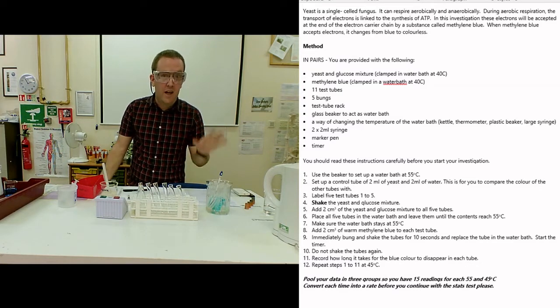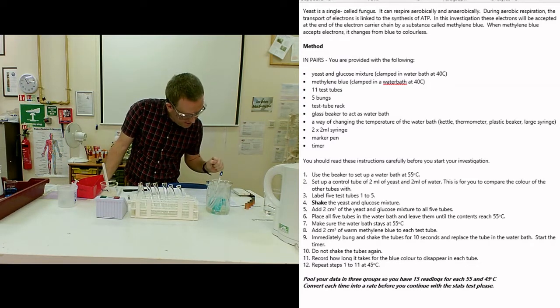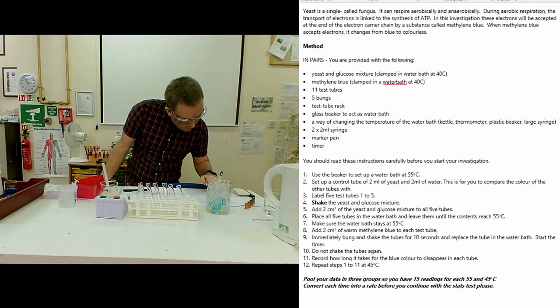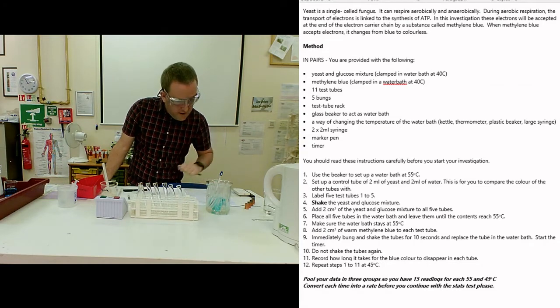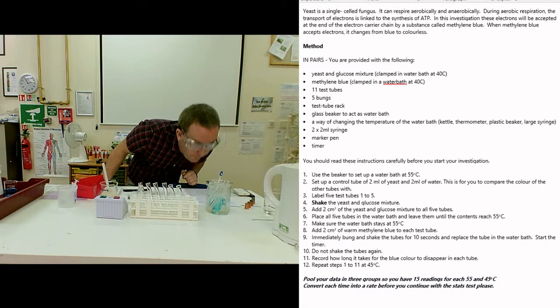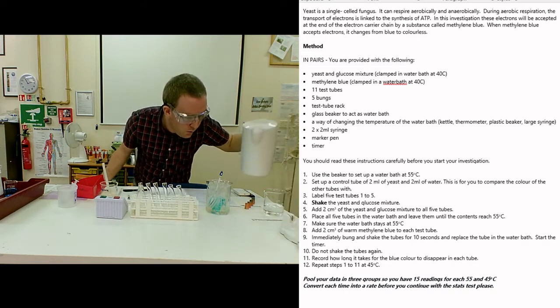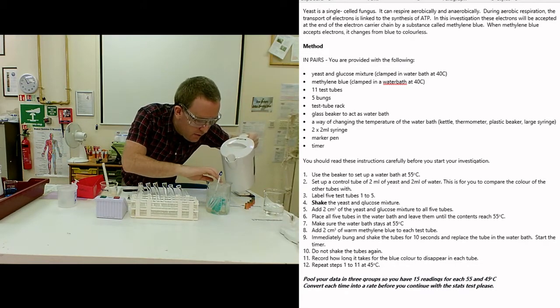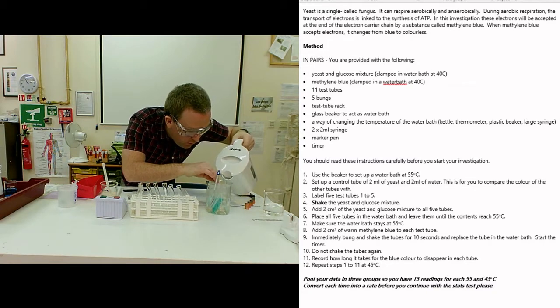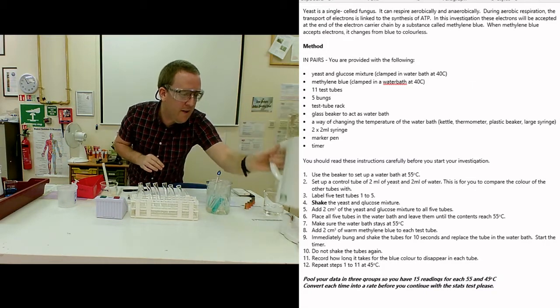Next, make sure the water bath stays at the right temperature. Maybe it's a degree cool, so I'll add just a little splash more hot water to bring that temperature up.